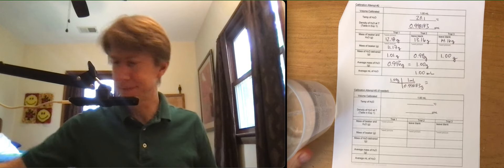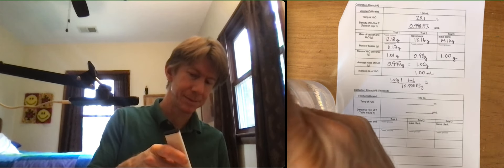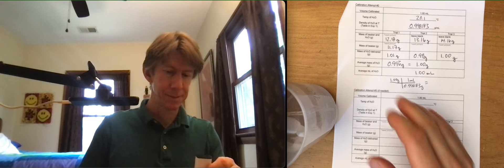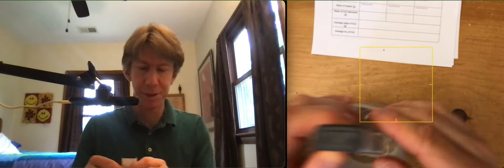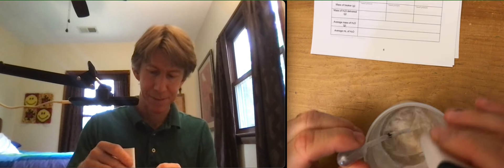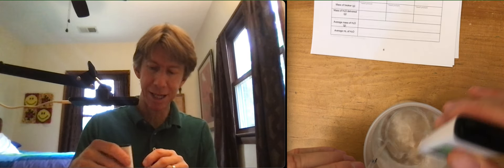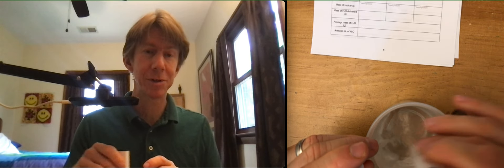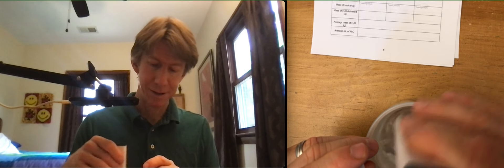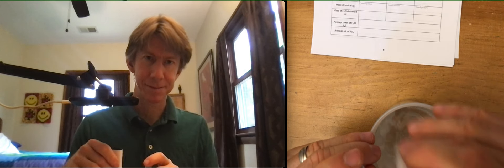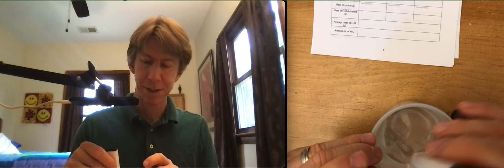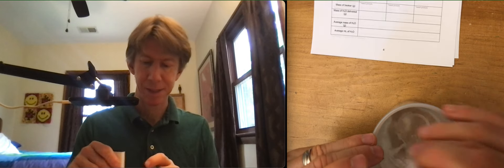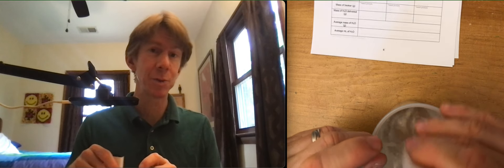Temp of H2O. My room is definitely warmer than this water. So technically it is not equilibrated yet, because it should be the same temperature as the room. But we will work with it. We'll just make sure we get the right temperature of the water. And I wish this would be a lot easier. I did wait half an hour.